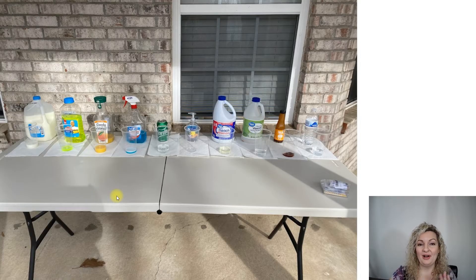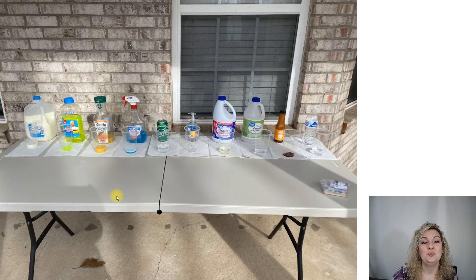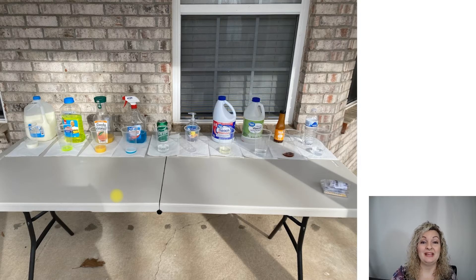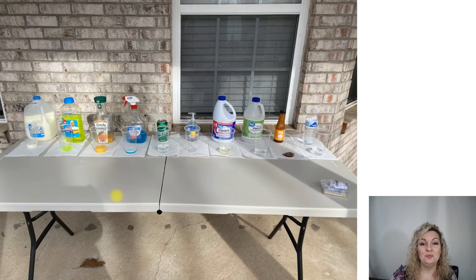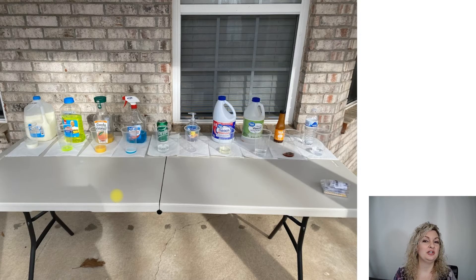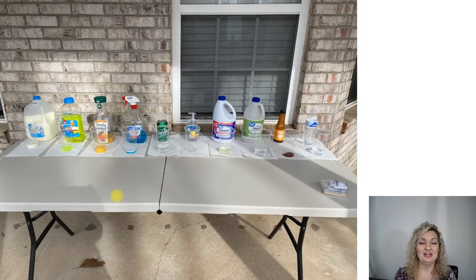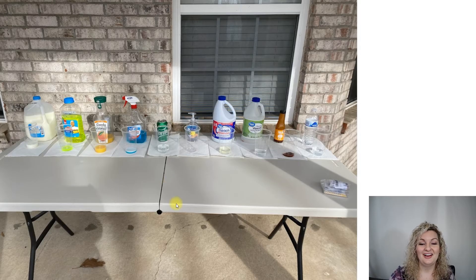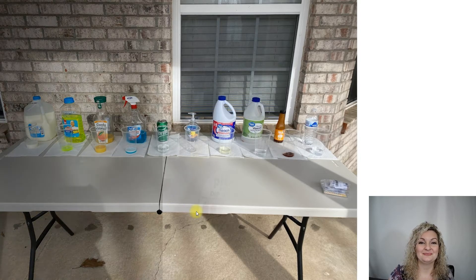Now is a good time to pause the video and make a prediction. Which one of these is going to be an acid, which one's going to be a base, and which one's going to be neutral? Take it a step further — do you know which ones are going to be a strong acid or base, and which ones are going to be a weak acid or base? Go ahead and pause the video and try to make that prediction now. All right, let's go ahead and do the experiment and see the results.